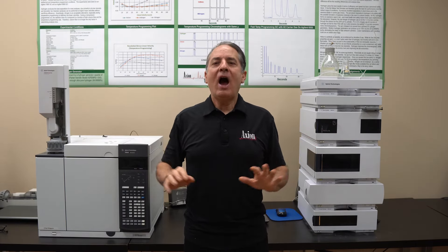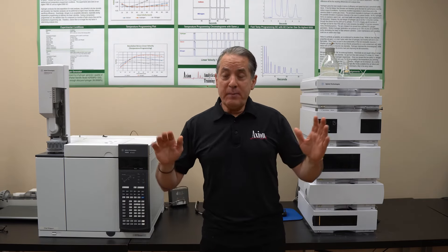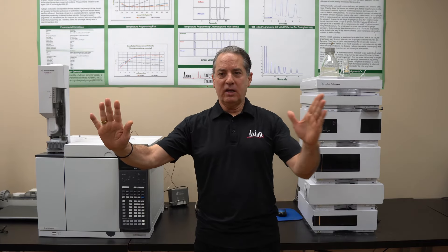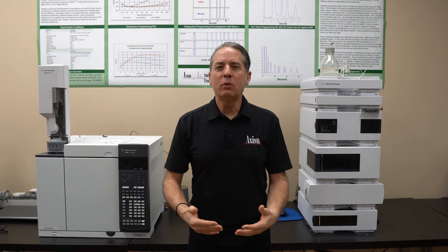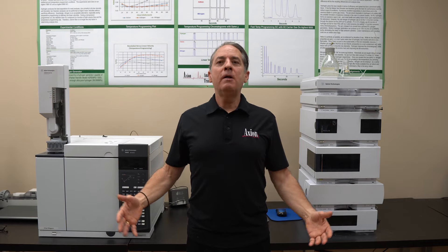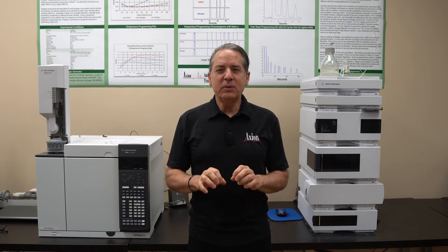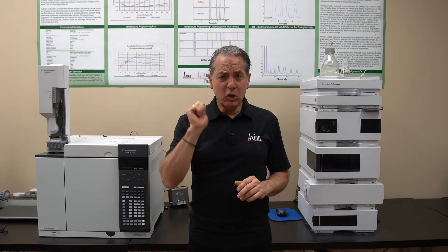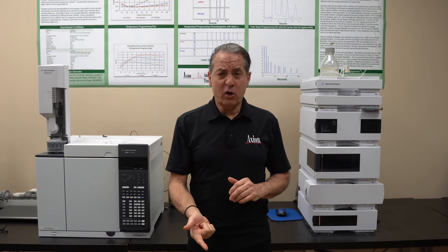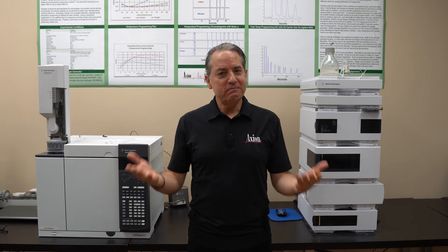In that one injection, you will know exactly where the peaks are coming off. From that point, if all your peaks are coming off between 75% and 100%, you don't need to start at 10% — you can start much higher. After that one scouting run, you'll probably have a working method. It'll probably be too long, and then all you need to do is optimize it. Method development in HPLC is a lot easier than people think — start with a good base-deactivated C18 column, do a gradient from 10% to 100% of acetonitrile or methanol in 30 minutes, see where your peaks come off. That's method development.